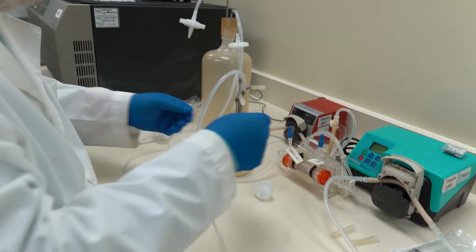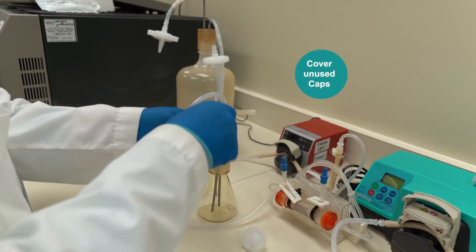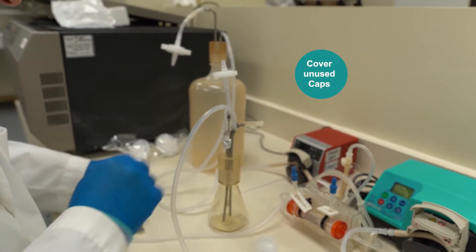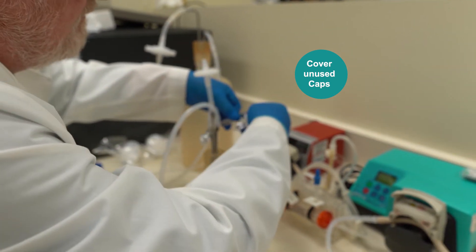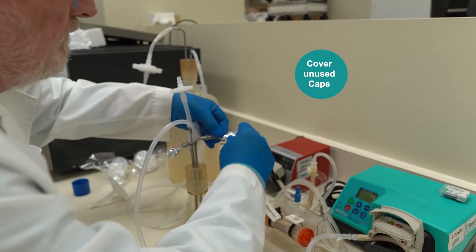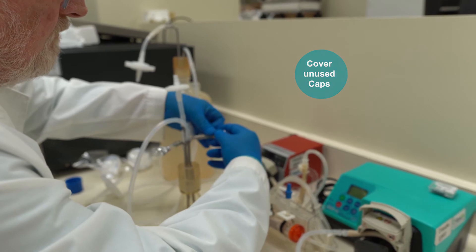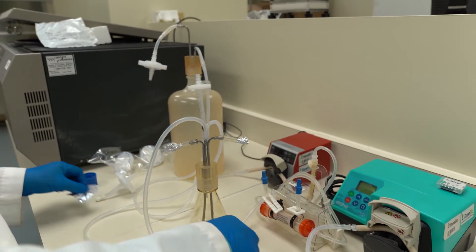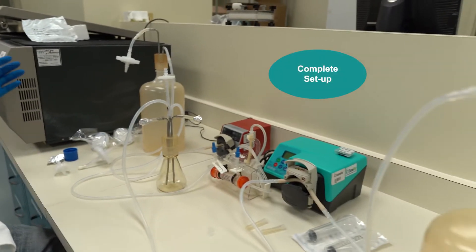So we have this set up so that all we need to do is cover this up. And this is all set. One entire piece.